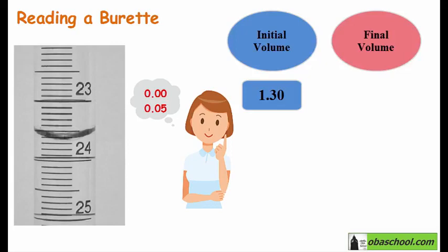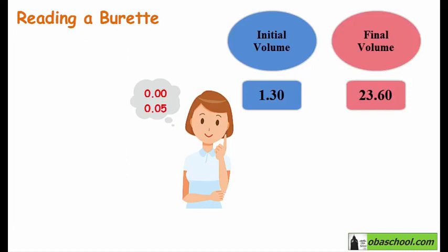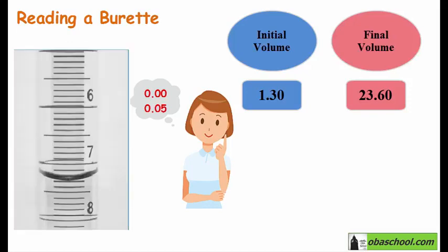This is 23.5 and 23.6. So remember to report your reading to 2 decimal places. Pay attention that this is 23.6 and not 24.4. We read in this direction. Try to find the initial reading yourself now, and then let's check the answer.